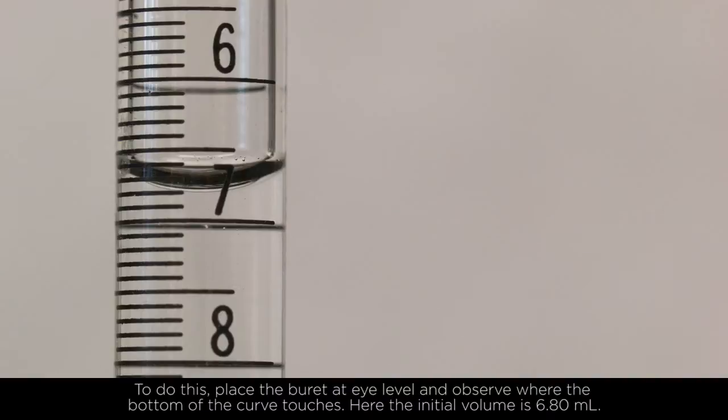To do this, place the burette at eye level and observe where the bottom of the curve touches. Here, the initial volume is 6.8 milliliters.